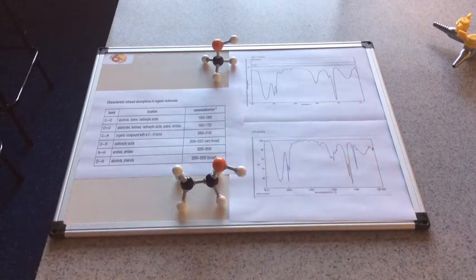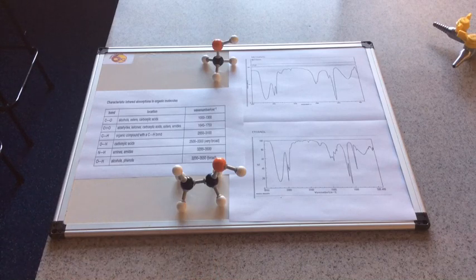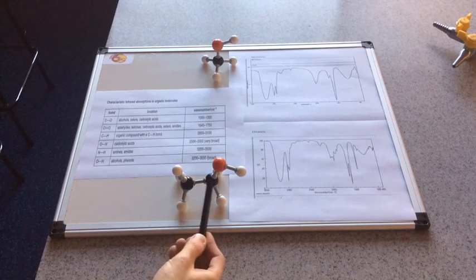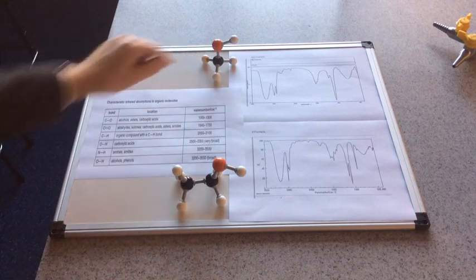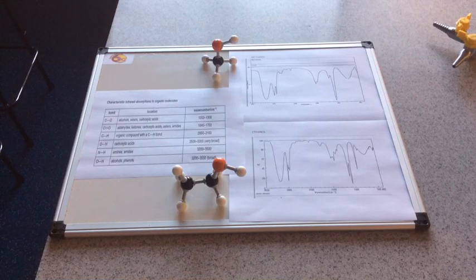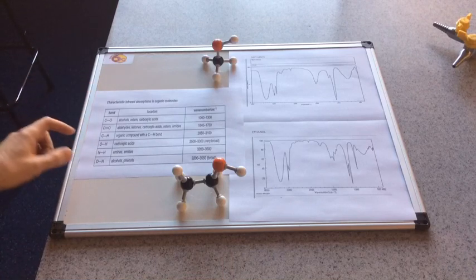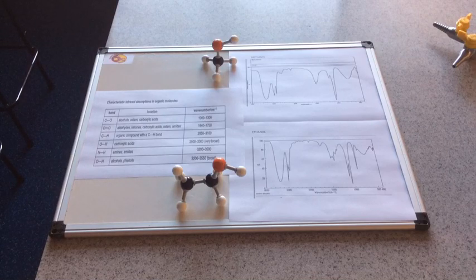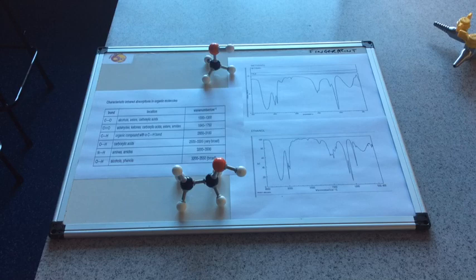That's in roughly the same region, about 1050 to 1100. Now you can see there's more going on in the ethanol molecule, and that's obviously because there's more to ethanol - we've got this C single bond C here which we haven't got in methanol. So that's obviously going to absorb a different amount of infrared, and you can see that it doesn't appear on the data sheet, so we won't look at that.